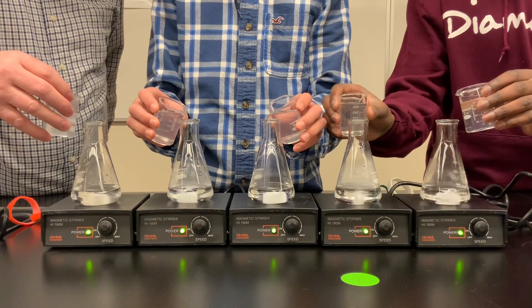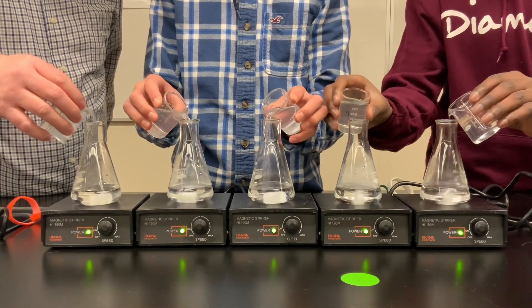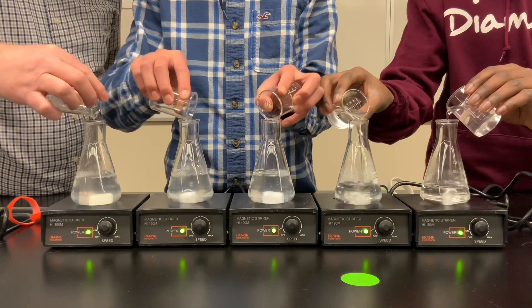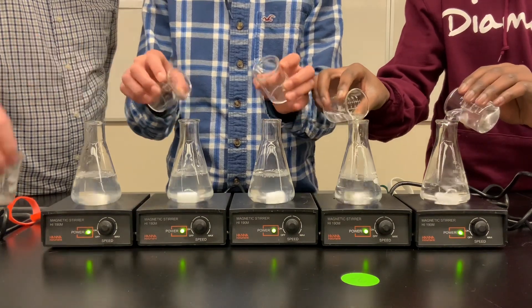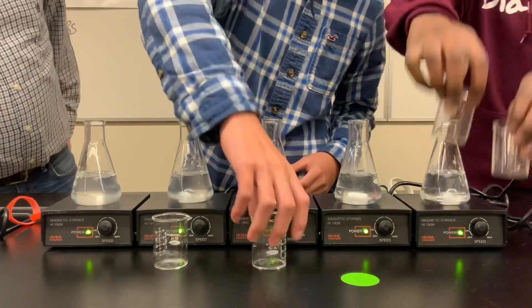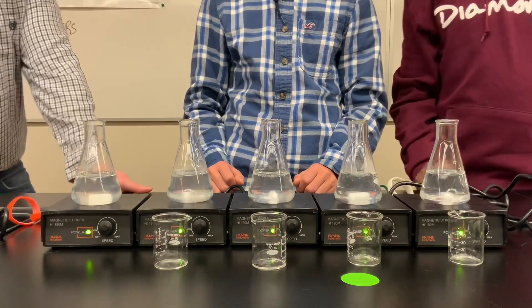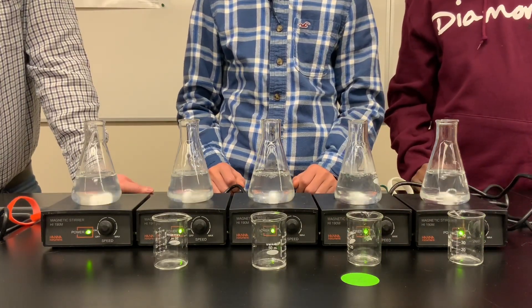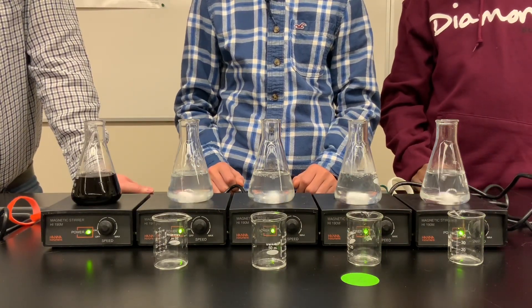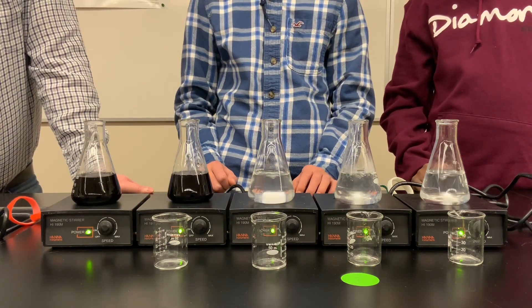Three, two, one, zero, go. As they react, at home, when you see something interesting happen, you need to stop timing for that flask.